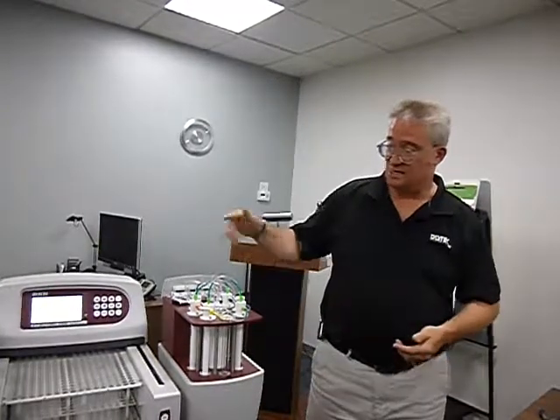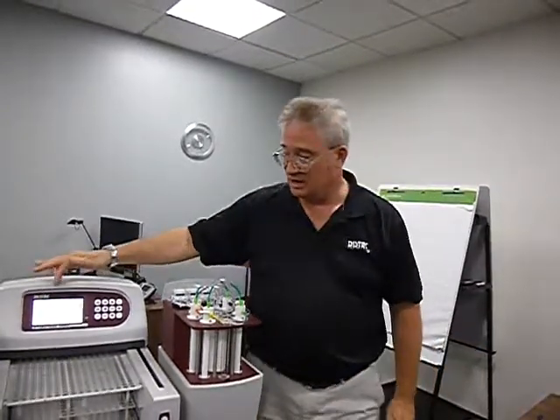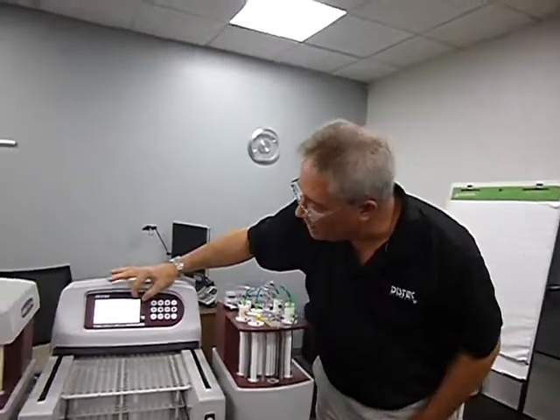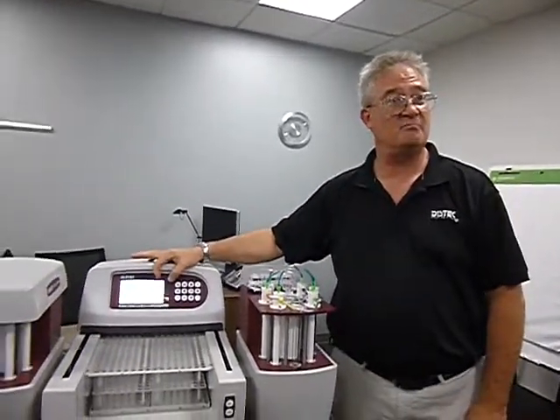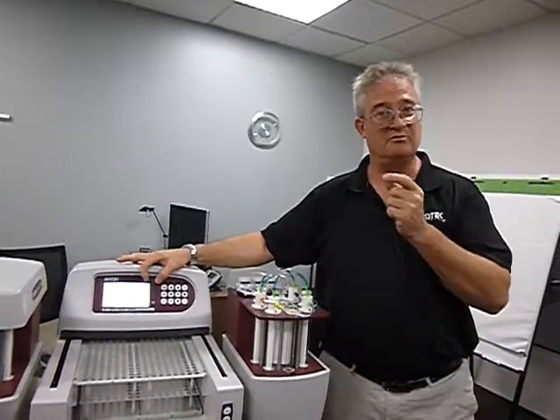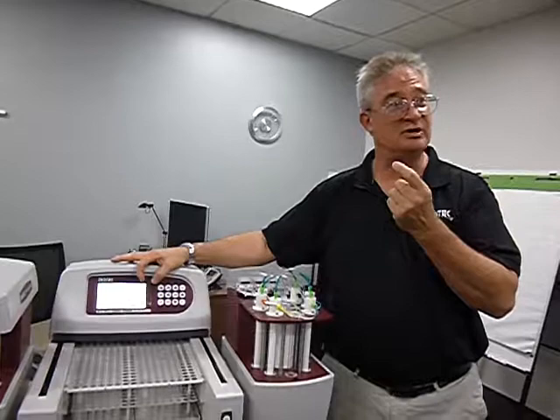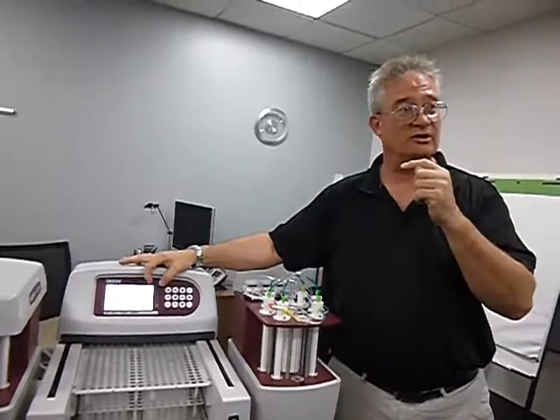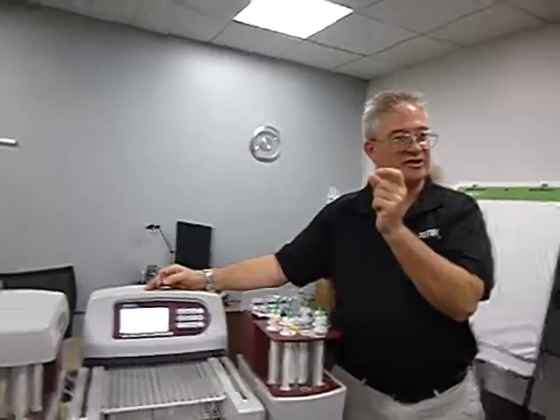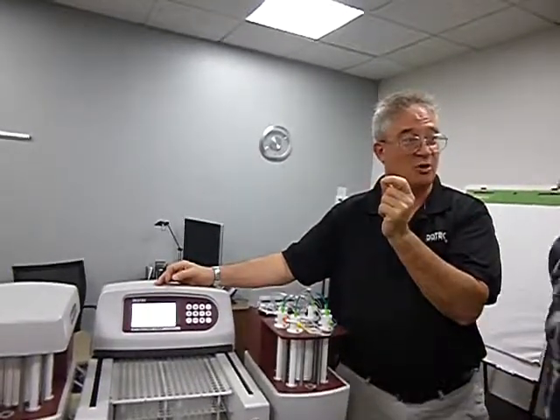And it tells you when you're in there in the parameter, you may not realize there's a little box sitting up here and it'll say min time, minimum time. That's the minimum allowed in between pulls. So as you adjust numbers in that method, you can see that number grow or get smaller.